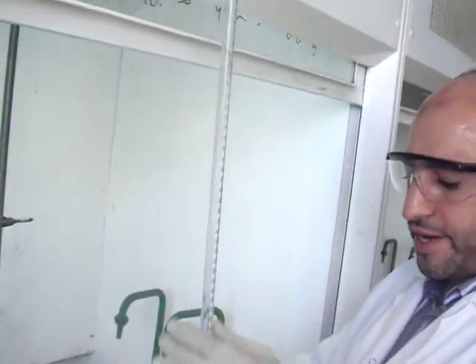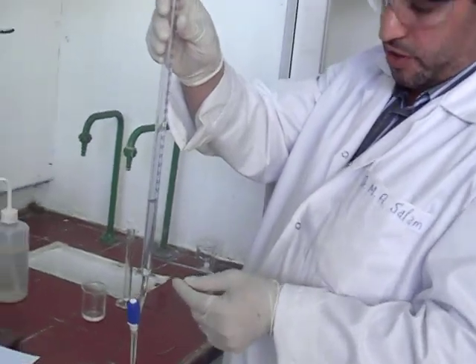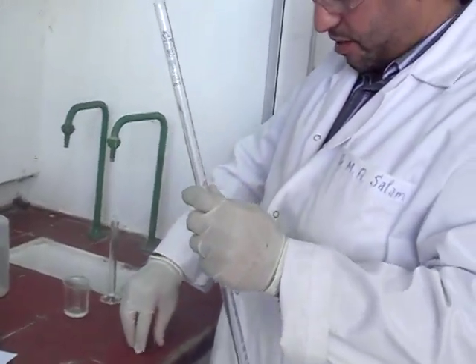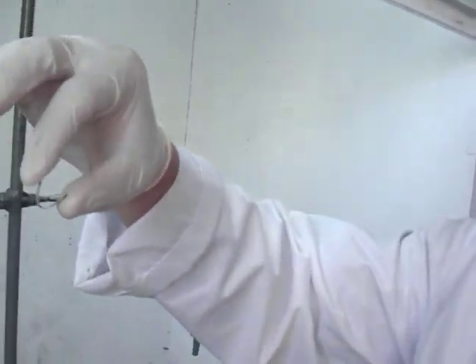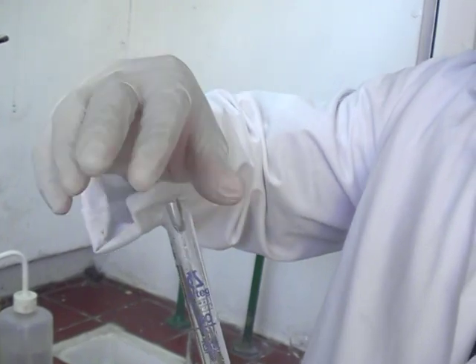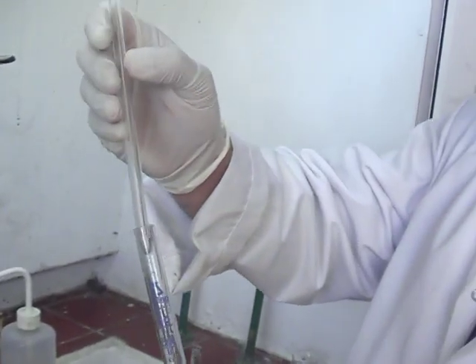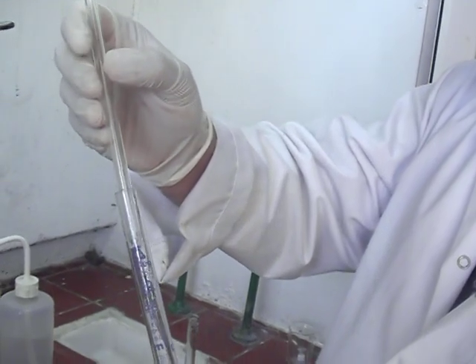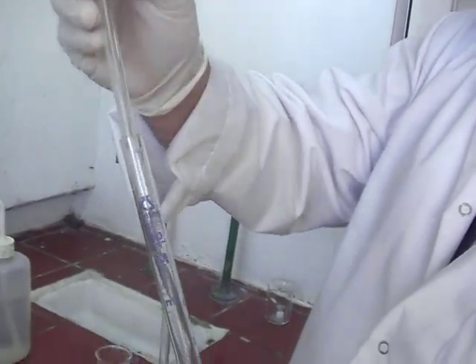Be sure all the acid transfers to the burette. After that, take your magnesium ribbon and bend it a little bit like that and insert it inside your burette. You can push it a little bit further using a glass rod like that to be around five centimeters down.